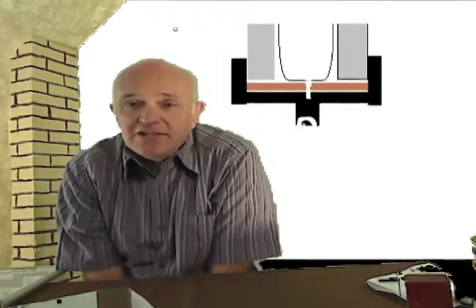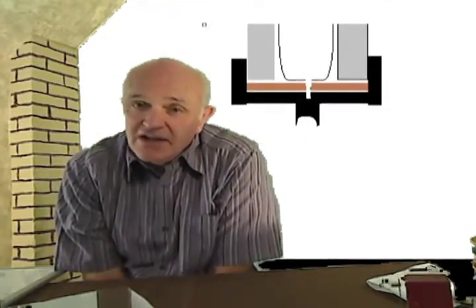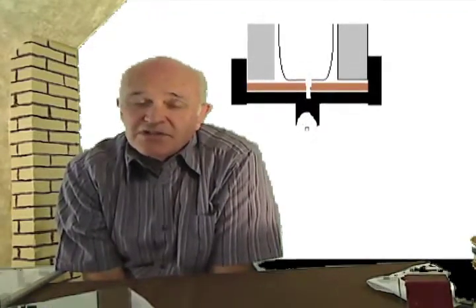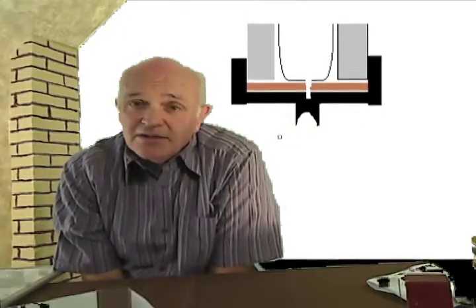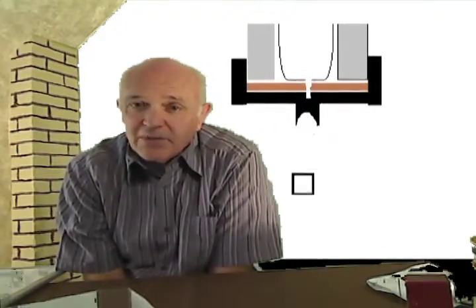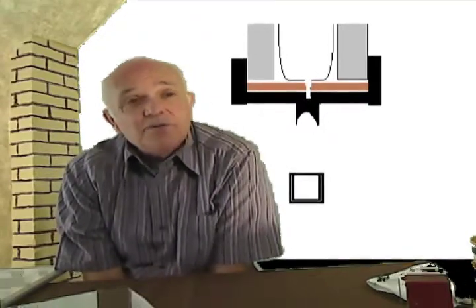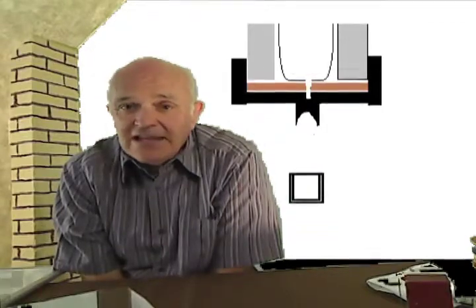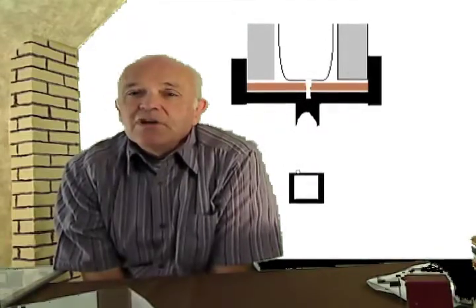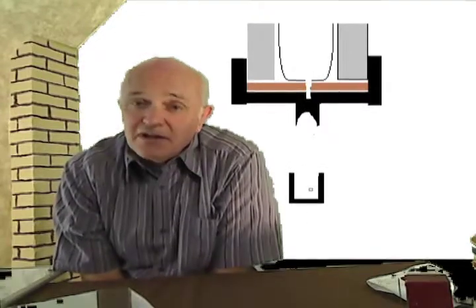So the routine is this, as part of regular maintenance. This is in the oven now. Open the oven door; it should be cooled off reasonably well. Loosen the nut with a little wrench. Make a note of how much column sticks out of the ferrule while you're at it. Cut off about 18 inches of column, just cut it off and throw it away. Slide the nut over the remaining part, slide the ferrule over the remaining part.